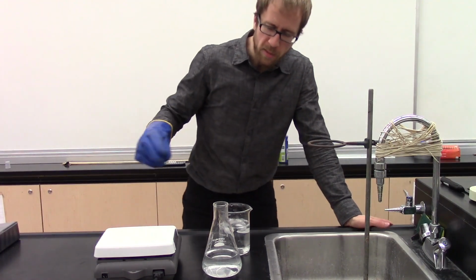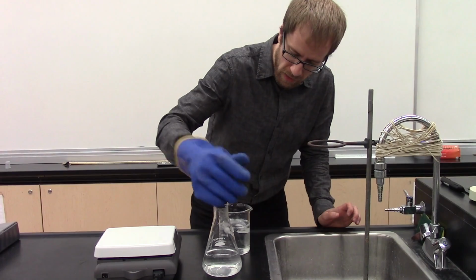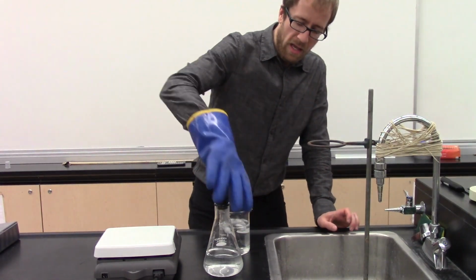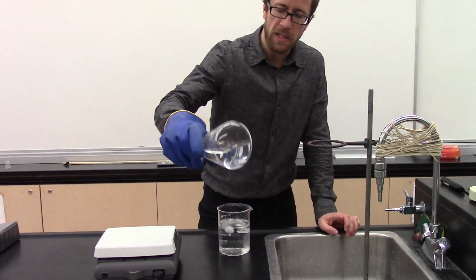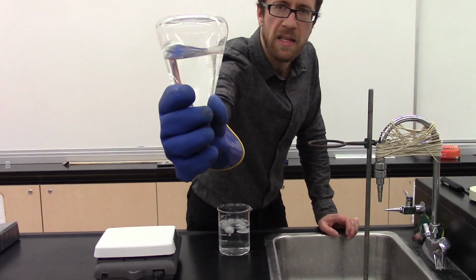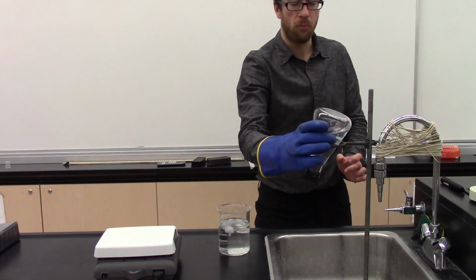Alright, there it stopped boiling, so I'm actually going to now put a rubber stopper into it, in there nice and tight. And now what I'm going to do is invert this flask, and again, it's stopped boiling, right? You cannot see the liquid boiling at all. And I'm going to put it inside this ring stand here.